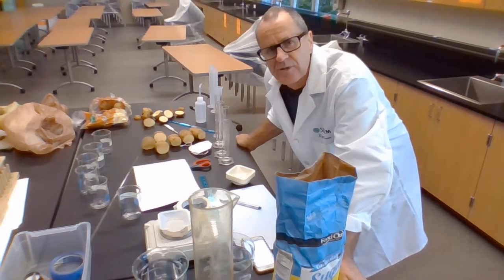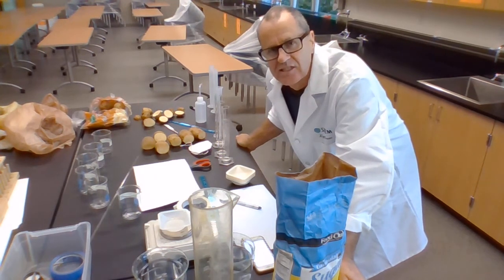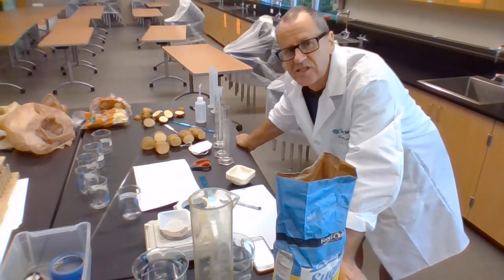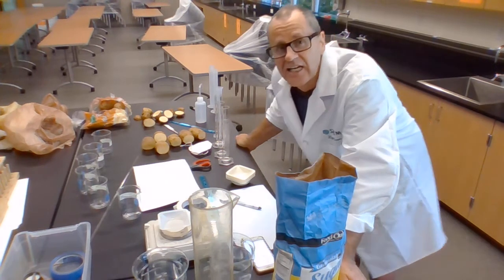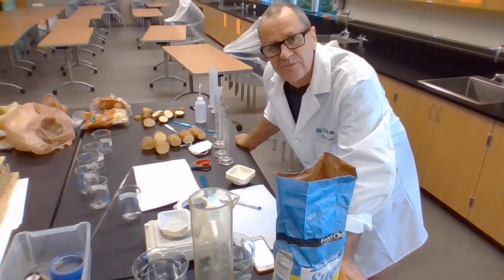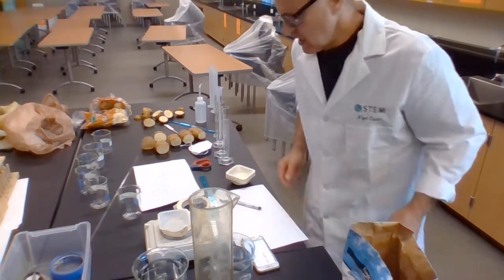Last year I split it up with my chemistry classes making the molar solutions and the biology classes doing the osmosis. We'll look at what those mean in a minute, but this year we're all going to do it because the osmosis is a check to see if you've made the molar solutions properly, and if you're only doing biology, then nobody's there to make the molar solutions except you at home. So here we make the molar solutions.